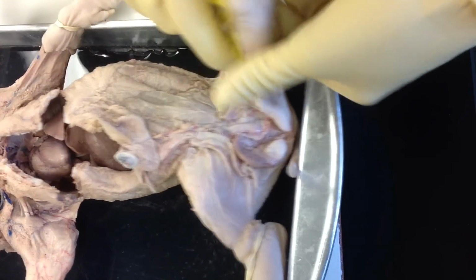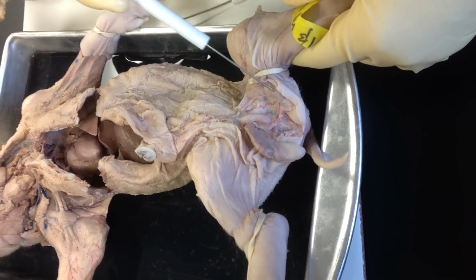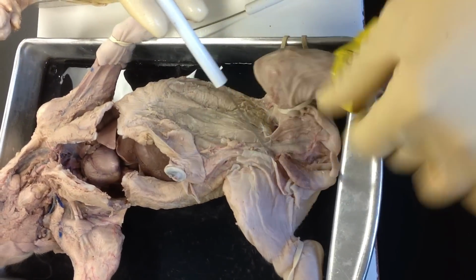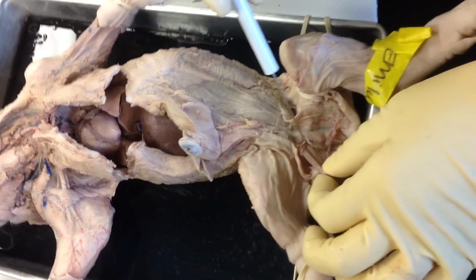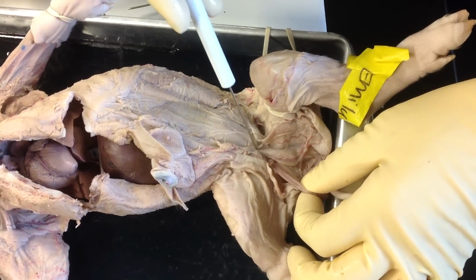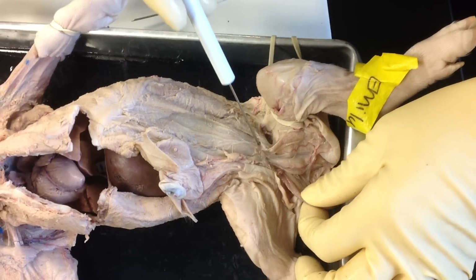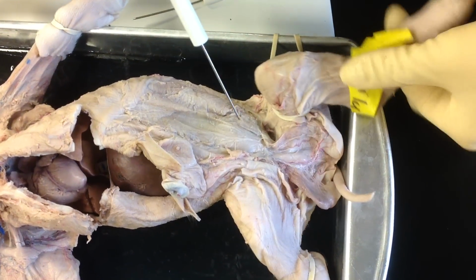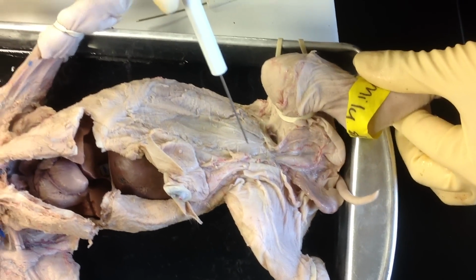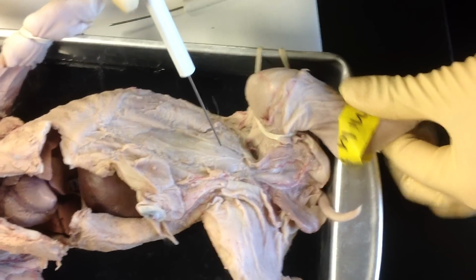Let's move to the male reproductive system quickly. This is a male because it doesn't have a projection outside of the urogenital opening. And these are one of two testes, okay? Of course, we dissected through the scrotal sac. And then I kind of tell you in class that life is a highway. So that's what I will be pinning if I pull on this tube-like structure called the vas deferens. Of course, that takes you to the ejaculatory duct and down through to the urethra, of course, where sperm and urine leave the male specimen, okay?